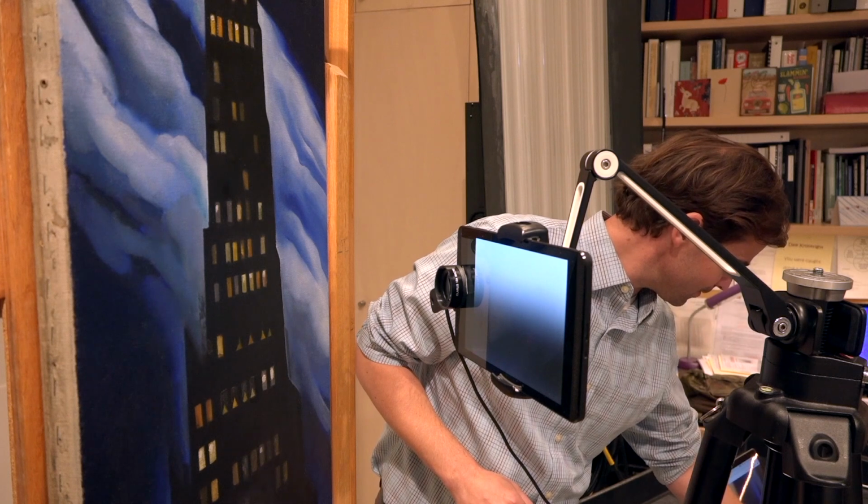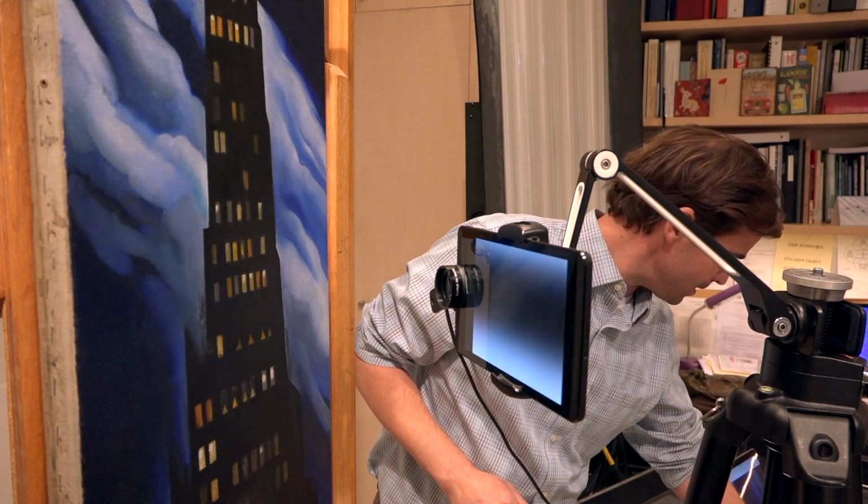So, we have this portable device, which is great. We can collect surface data. And then of course the question is, what does one do with this data?